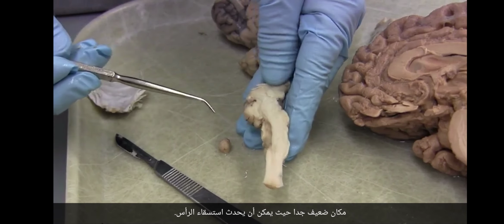We're making a lot. I can't quite remember how much, but on the order of a liter or so each day. So a lot. And the biggest pump is in the lateral ventricle, and it goes backwards through the foramen Monro to the third ventricle, back through the aqueduct, through the fourth ventricle, out Magendie and the two Luschkas, and then that surrounds the whole brain.